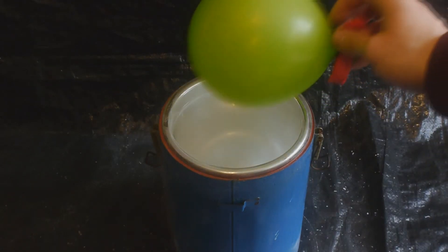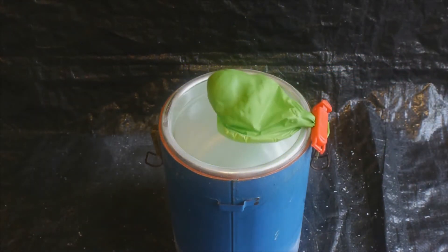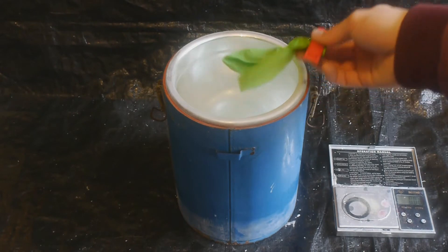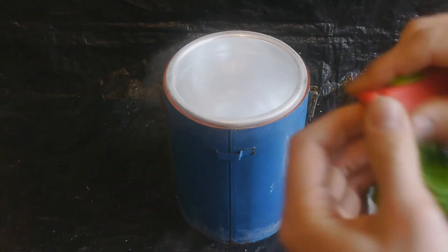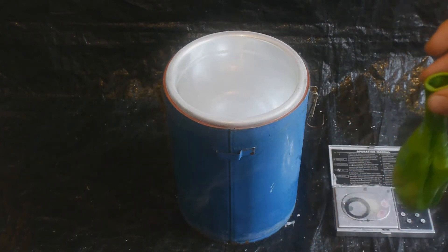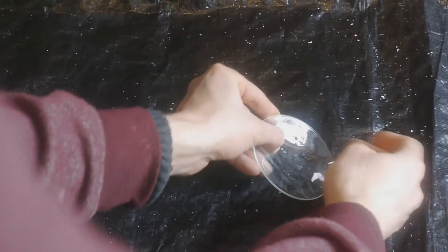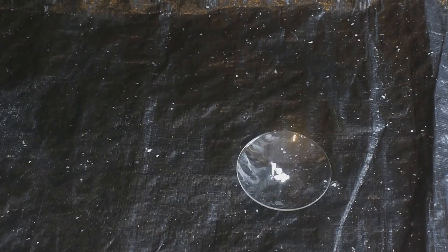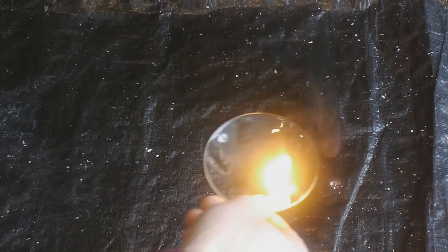Now let's try to freeze our acetylene. Let's see how much that weighs. A much more interesting question is whether I can get some out. I need to think of a more clever way of doing this — actually, I did get some out on the first attempt. Let's light it on fire. It's amazing.